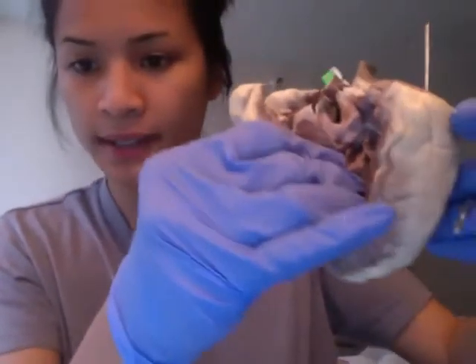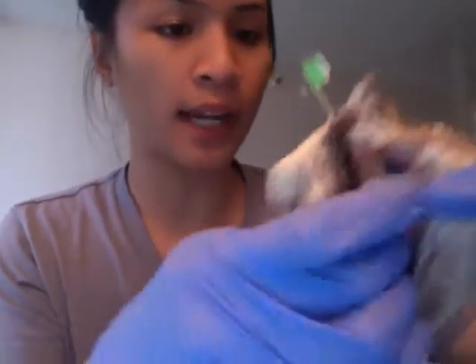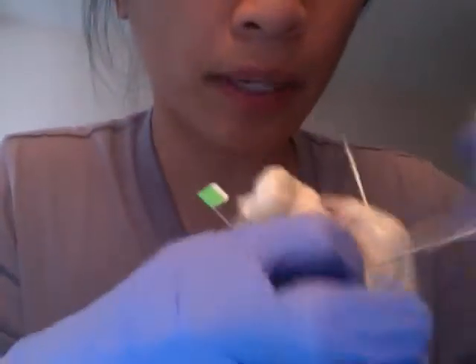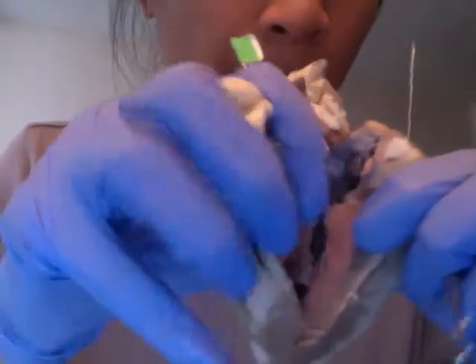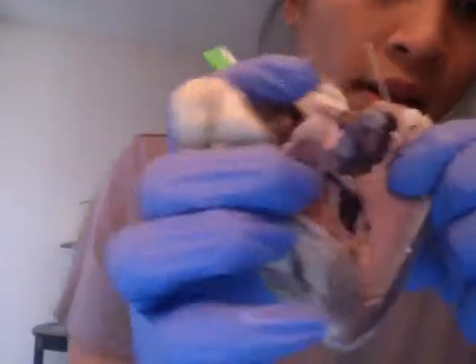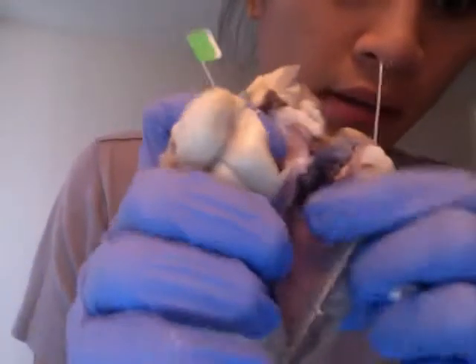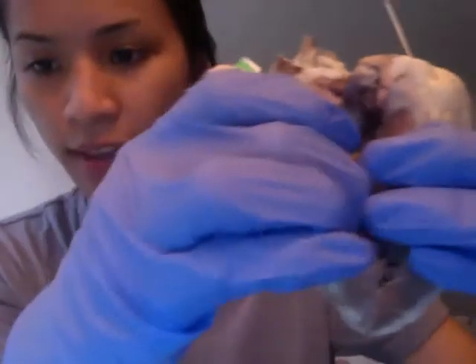And for the right and left ventricle inside, the right would be on this side and the left on the other side here. This hole is very deep and the lighting is not that great.